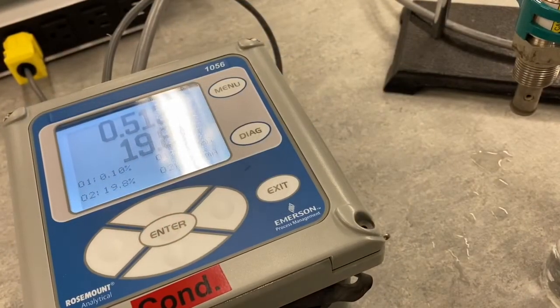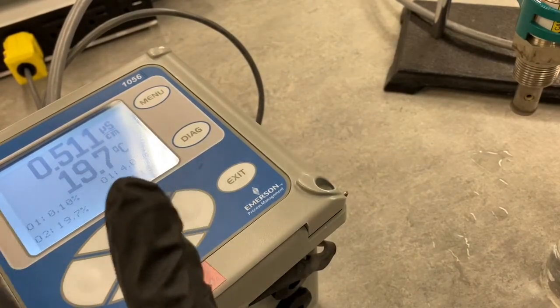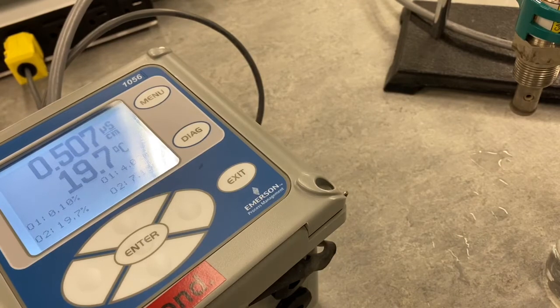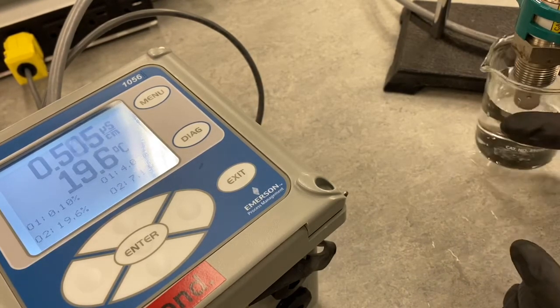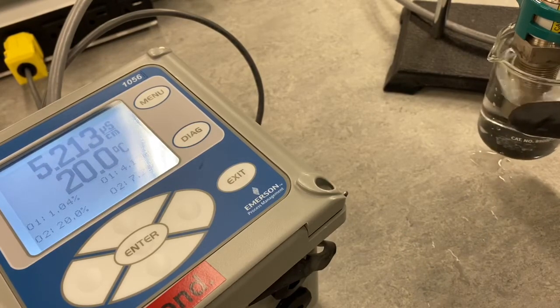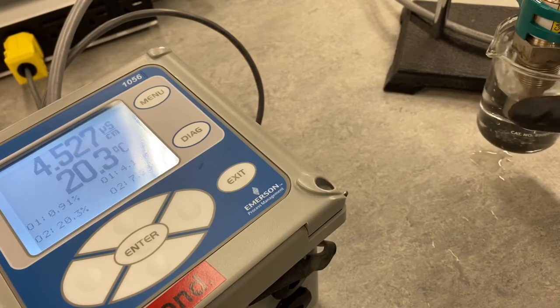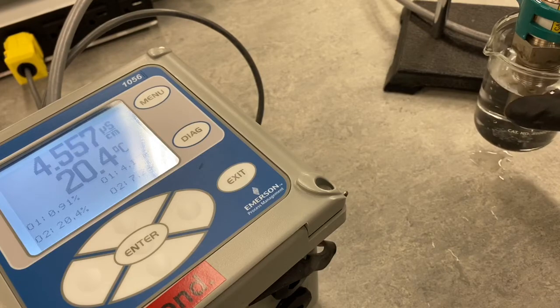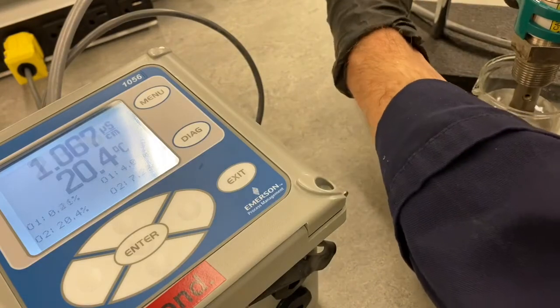The next thing we're doing is taking a sample measurement of deionized water. You can see I've pulled the sensor probe out now. It's exposed to air, and the conductivity is lower. Now I'm going to expose it to deionized water and see what we get for a reading. It looks like for the deionized water we're getting a reading of about, let this stabilize. And what I'll do is drop this down into the sample.